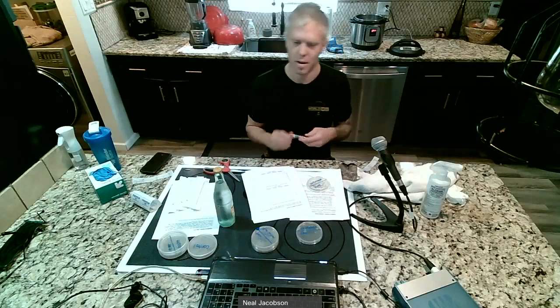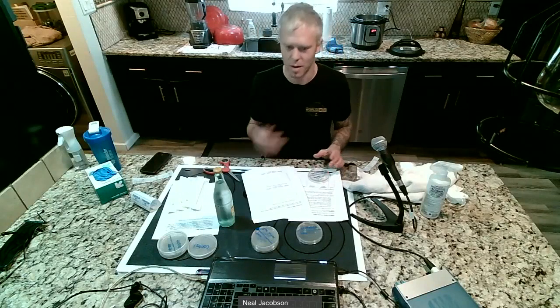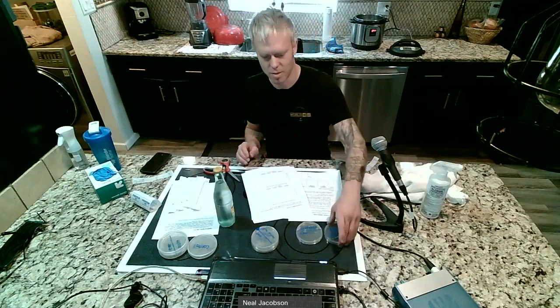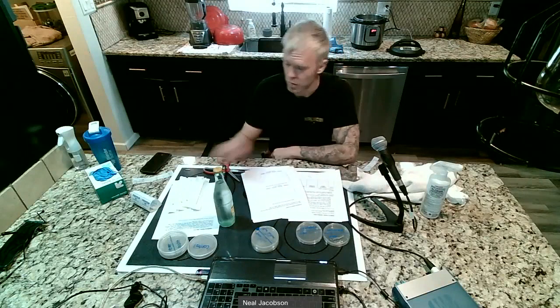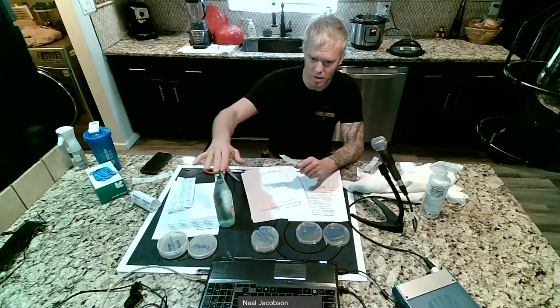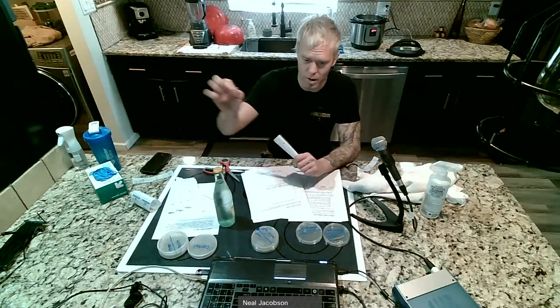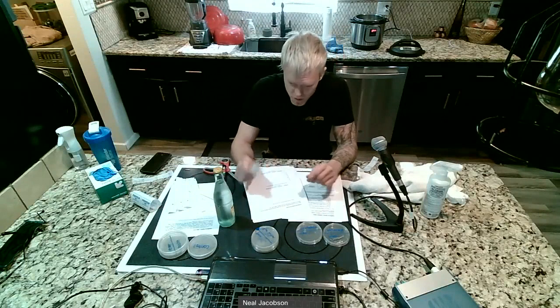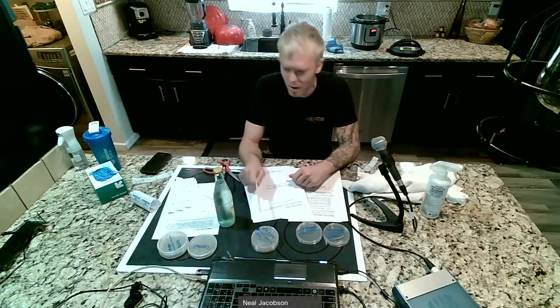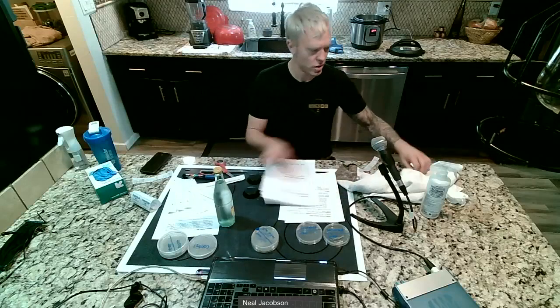All right, I'm using a paper pen, and I'm tempted to blow on it, but if I blow on it, bacteria from my mouth might end up getting through the cracks onto the plates. Okay, so I've labeled those. I'm not gonna bore you guys with walking around and sampling stuff. You've already seen how I did it before. I'm keeping the lid on my water source. I'm opening up my sterile swab only when I'm ready to do it, and then I'm covering the entire half of that plate.